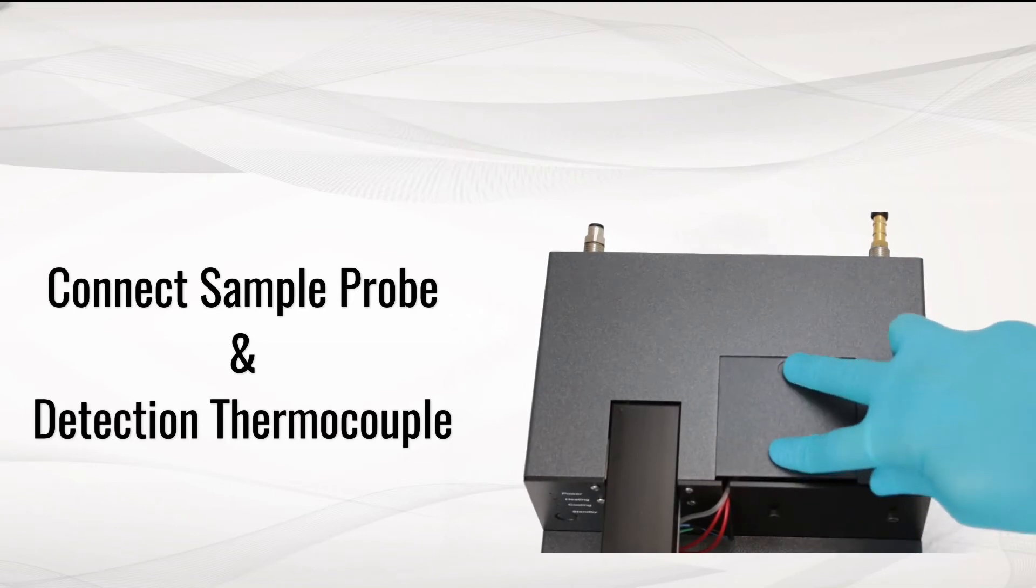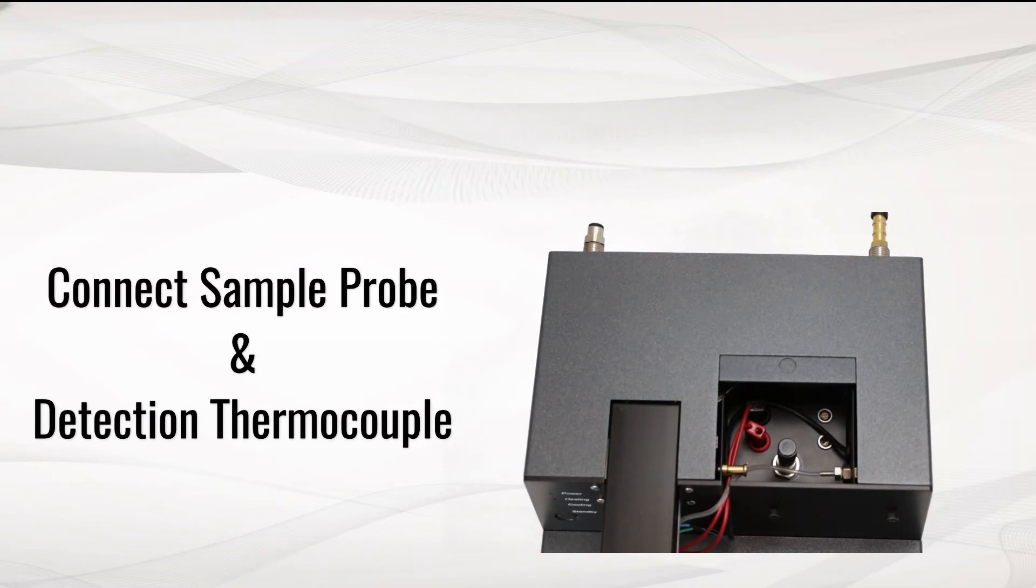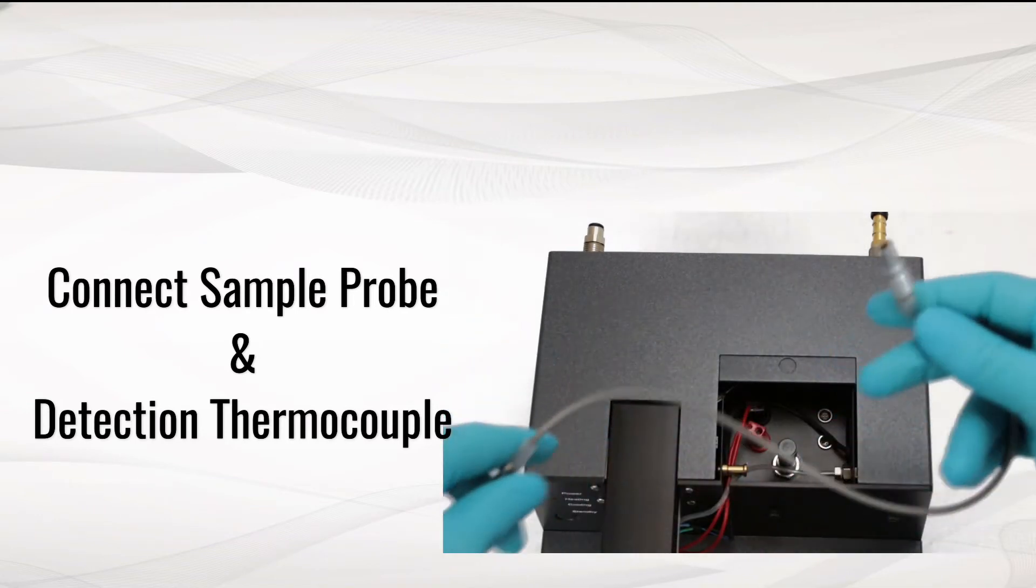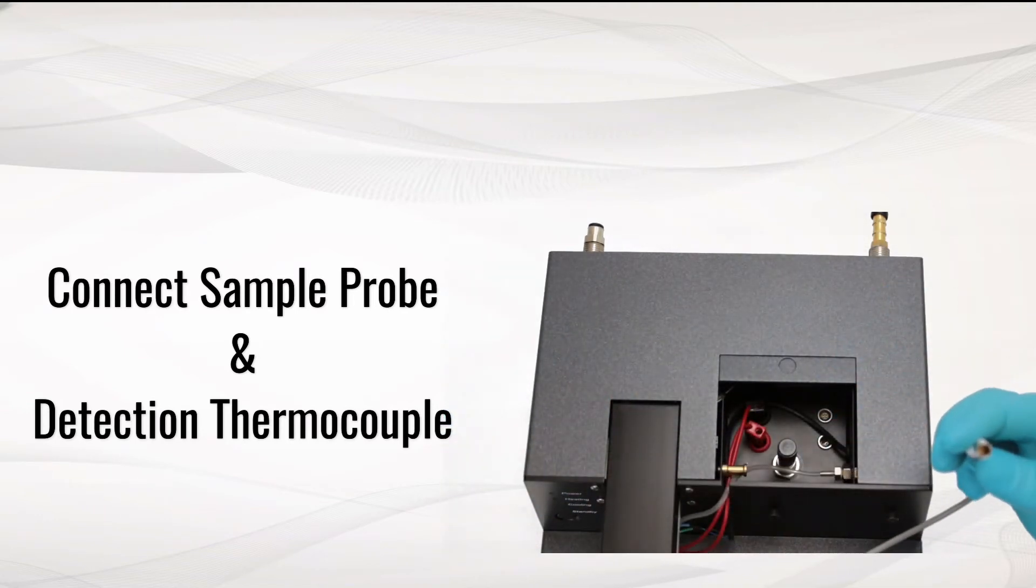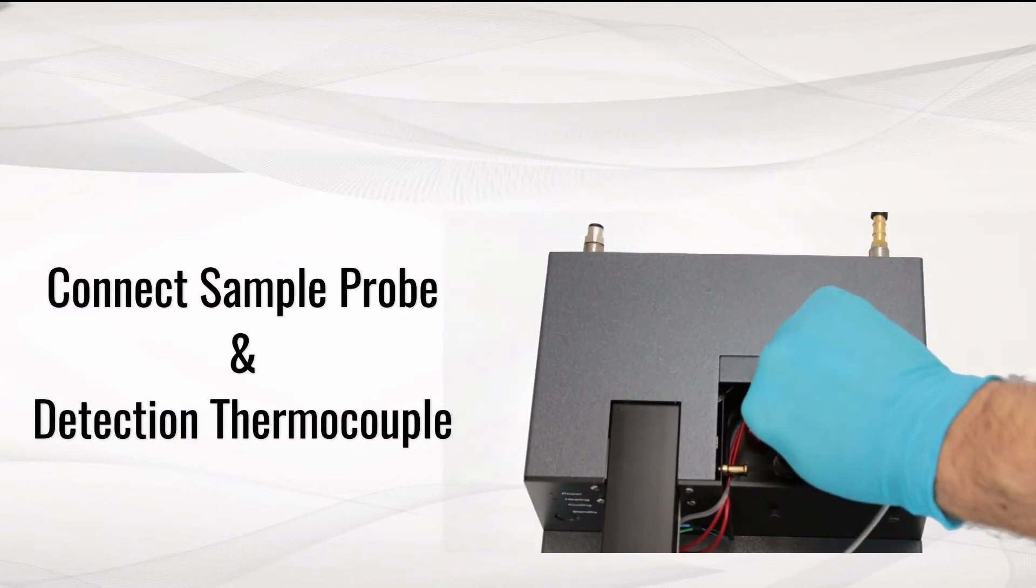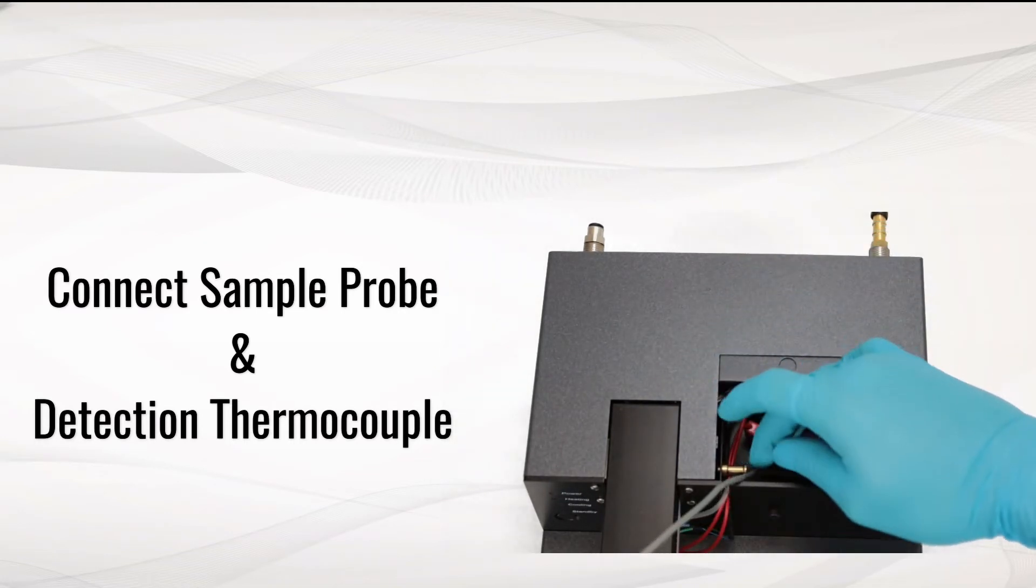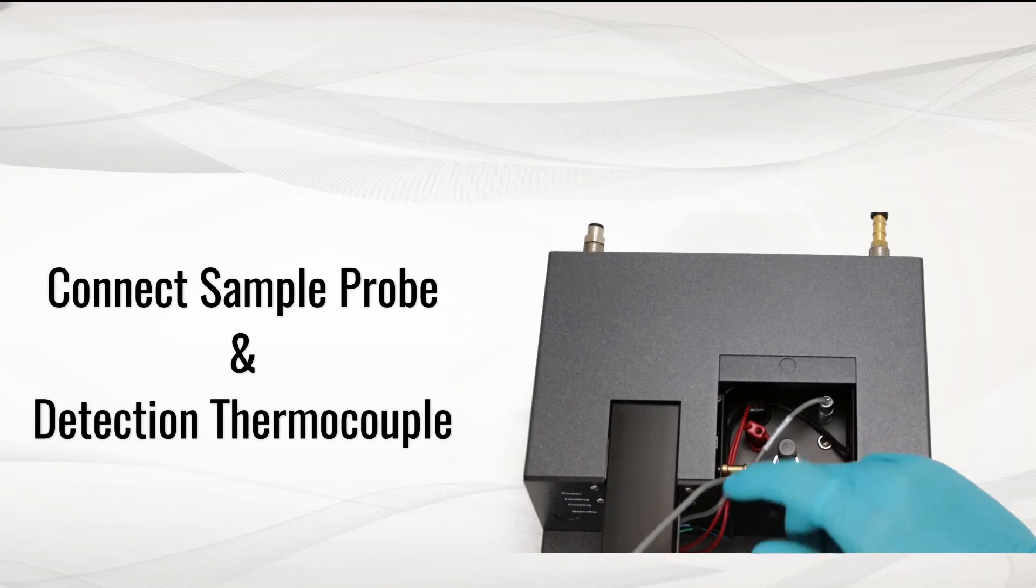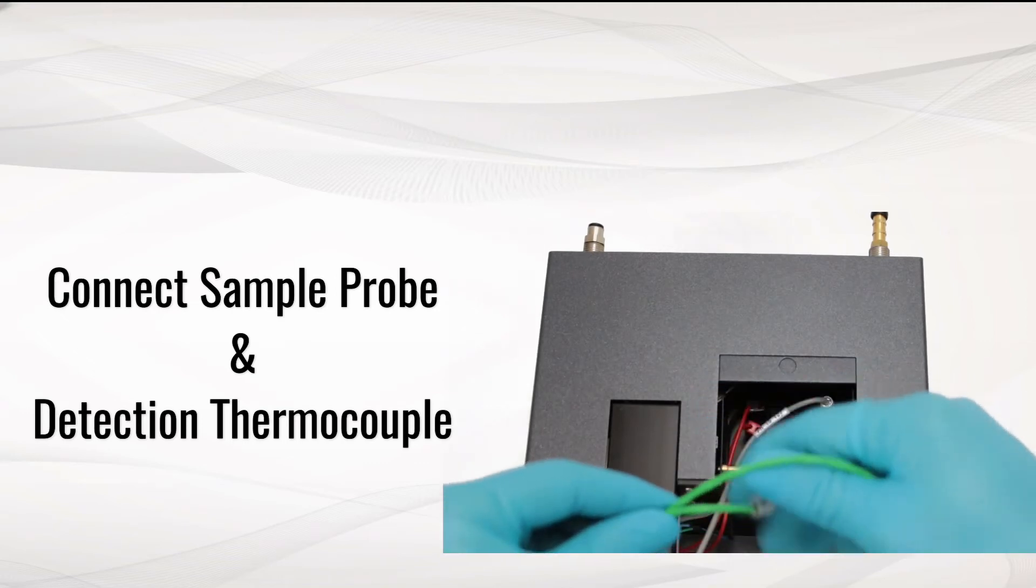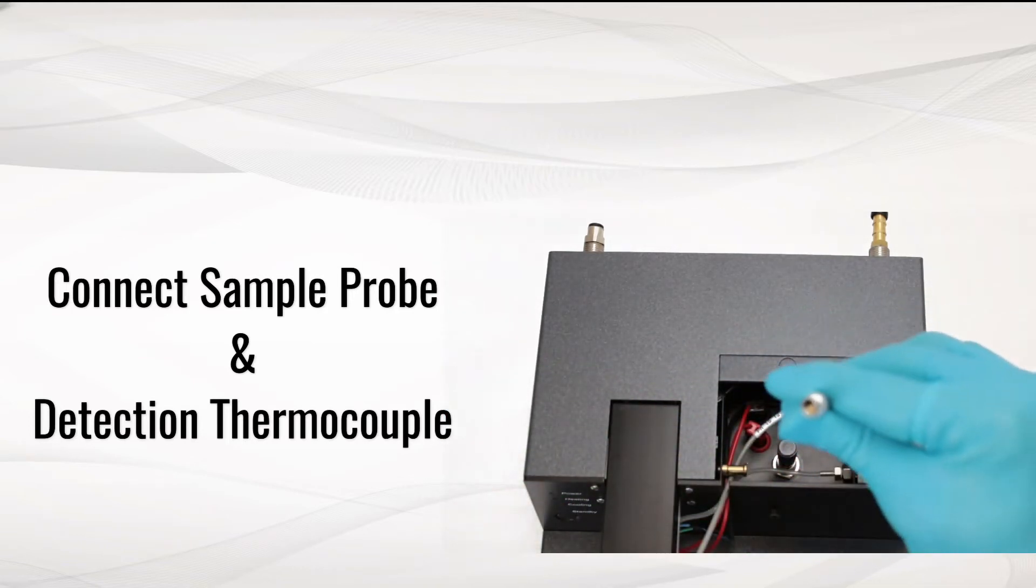Slide the top panel in order to access connection area. Plug the sample probe. Pass the cable in the opening. Proceed in the same way with the detection thermocouple.